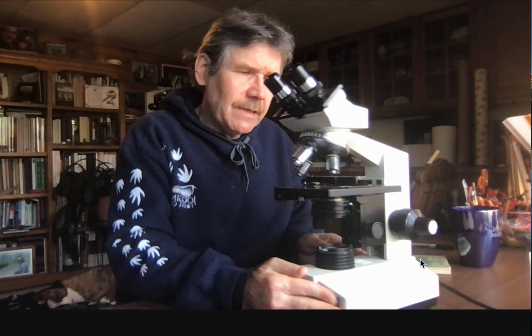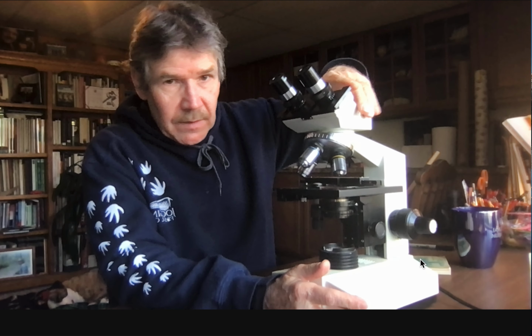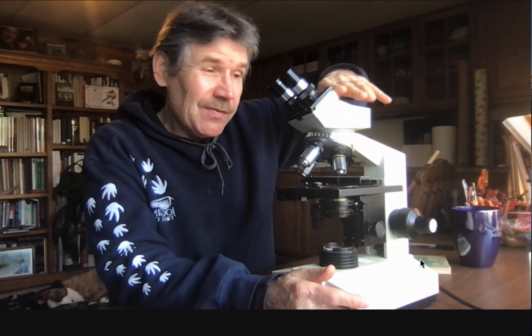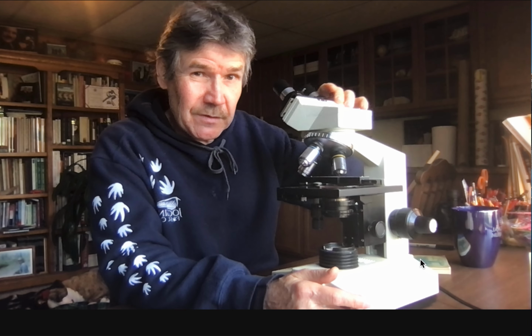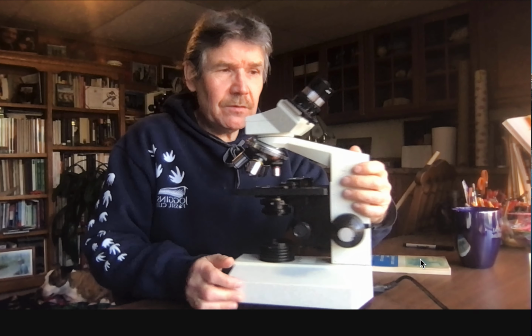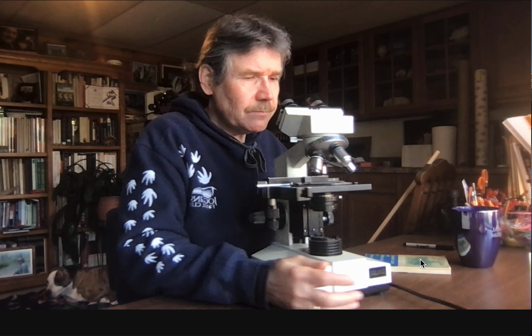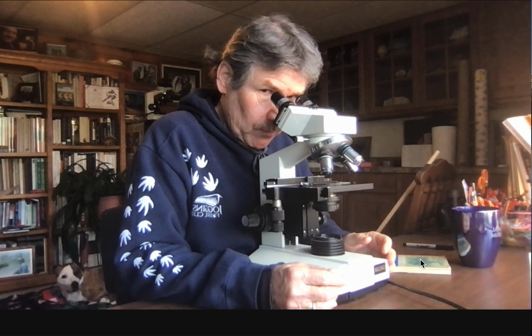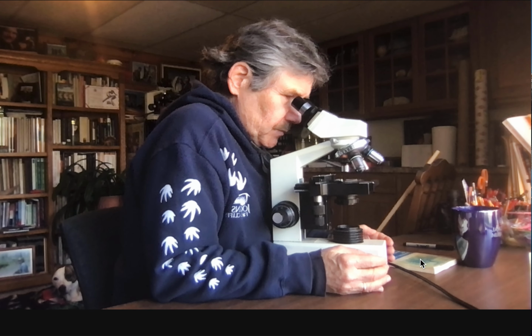Now, while I was doing that, I was noticing something else that I thought I'd tell you about, and that is, look at this. This is a microscope that you can rotate the head around all the way over here, and you can look at it from that direction. So I could look at the microscope like this. But one of the things you should notice about me is that when I do that, and be true about you too, because the general morphology of humans is similar.